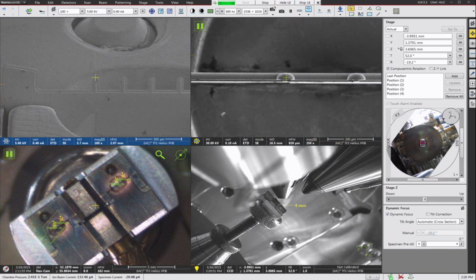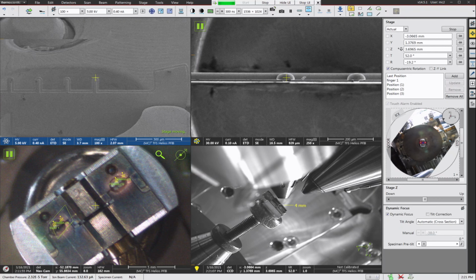And add. Now, I'm just going to, for convention's sake here, call the grid finger that I'm on right now position number, or grid finger number one. So we'll just say this is finger one. And this one will be finger two. Finger three. Finger four. Forgot my space there. Okay.